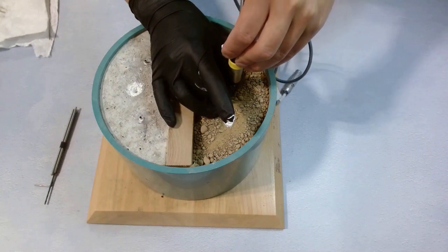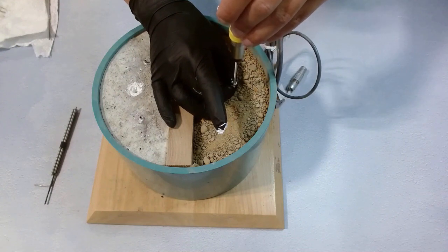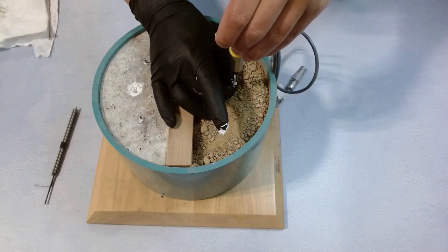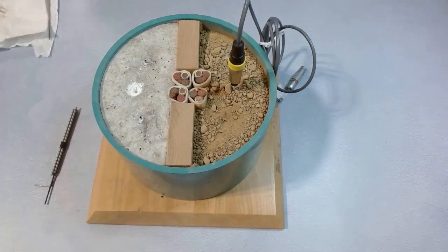We push it in again. Give it a little twist. We pull it out. This time it is entirely covered with thermal paste. There's no shiny part again. So we put it back in and we can run tests like this.